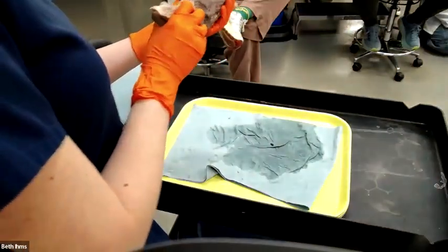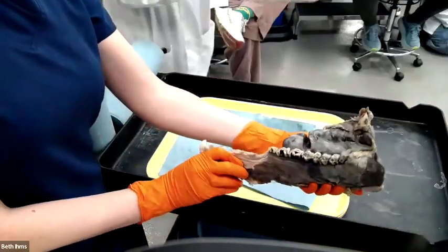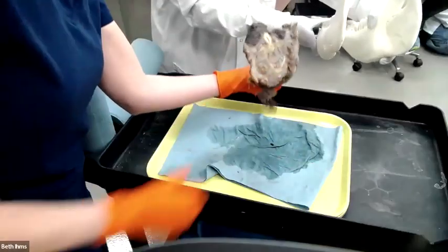So when we're playing spot the difference, got my lovely assistant here. Hold up the mandible so they can see it. Over here. Here you go, Zoom friends. So here's our tissue, and then look side by side.